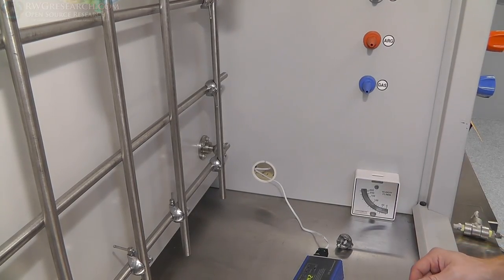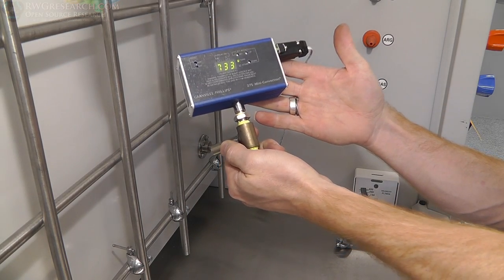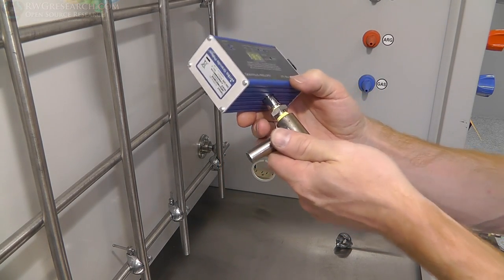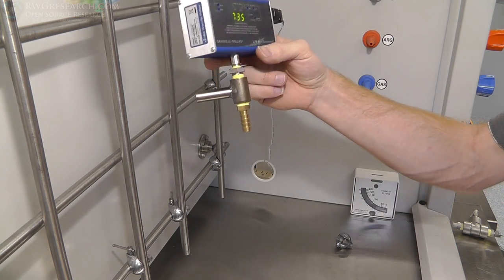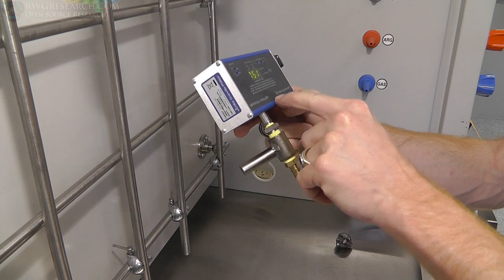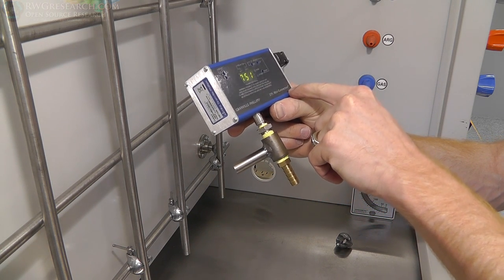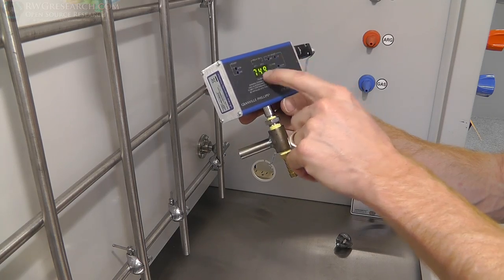You have made it inside the lab hood. So here's what we got. We have here the vacuum, or negative pressure, low pressure vacuum side sensor. So this is a Granville Phillips 275 mini convectron. It's got the digital display on it, so we can see it here.